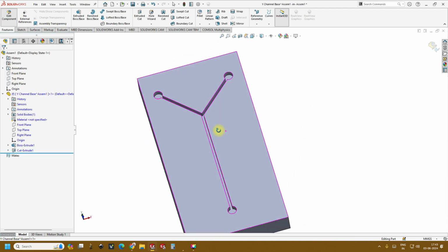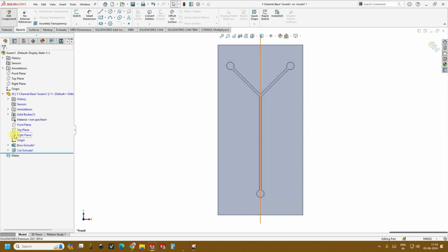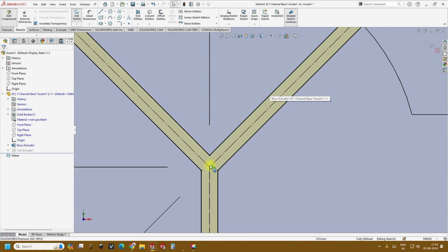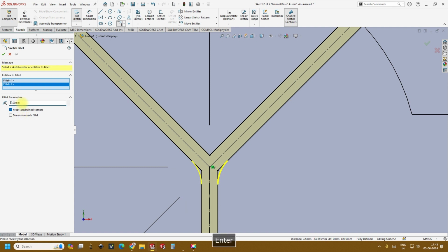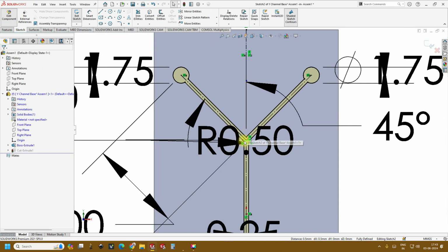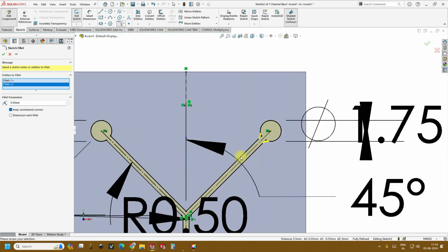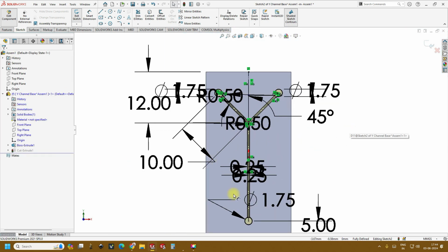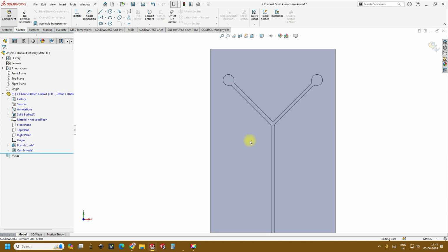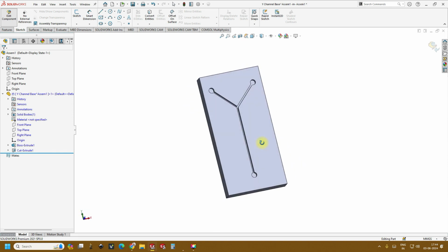This is how the Y channel has been made. And in short, if you wanted to edit something, go to the cut extrude sketch, create sketch. And here we can give a little fillet. Somewhere we can give close to a 1 mm fillet or 0.5 mm fillet. The same thing you can give at this edge. Just avoid the stress corners. Okay, let's come back out of the sketch. So now we will see a microfluidic channel with 1 mm depth and 0.5 mm width.